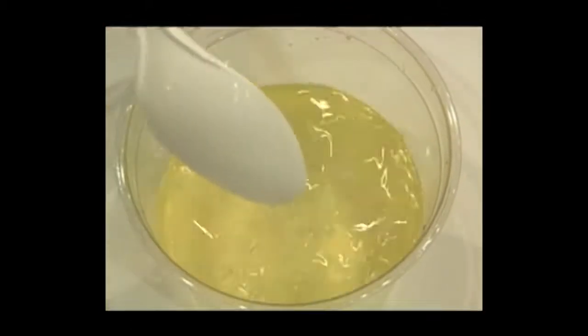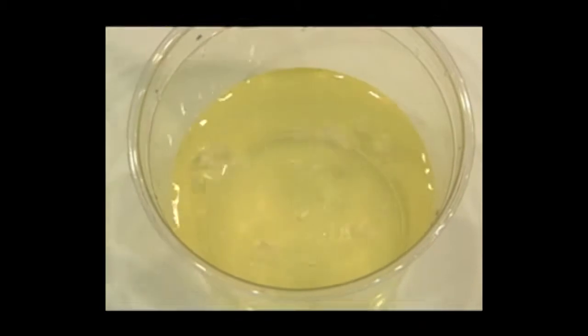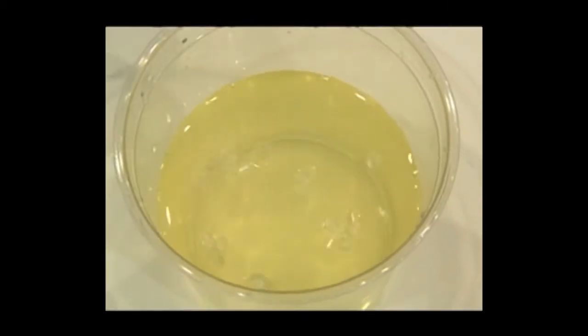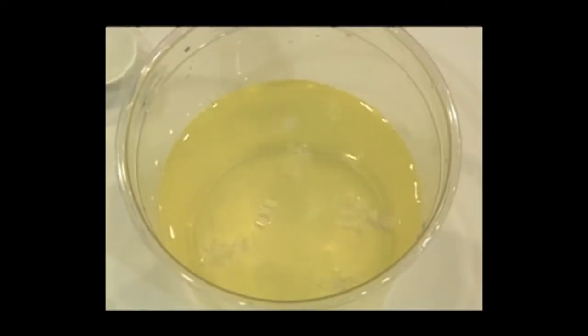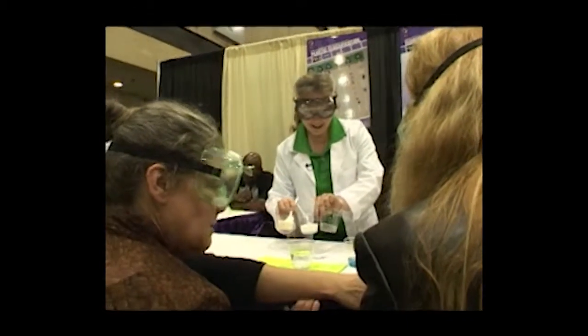There we go. We've got some round ones that are still floating and then some that are a little bit longer. So we need to add some more water. Very good. Those are the three sinkers.